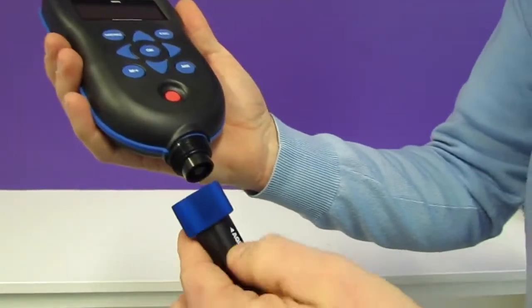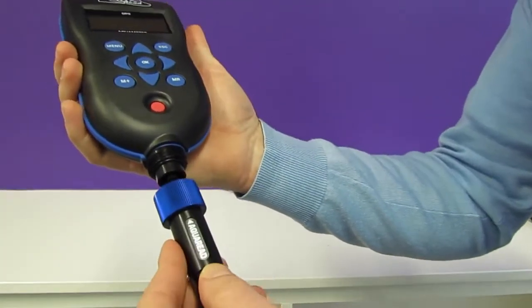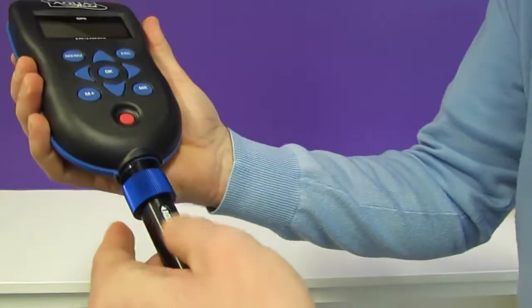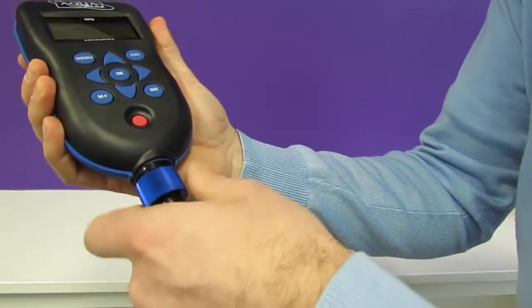Let's connect the meter up to one of our cables. We face the AquaRead logo forwards, push together, and screw the collar together.